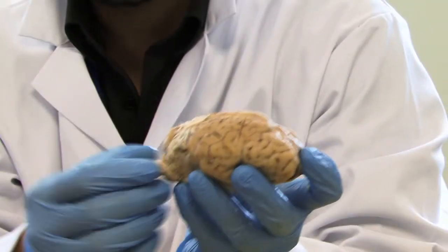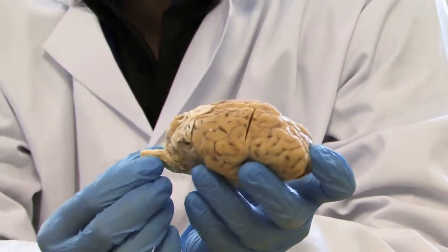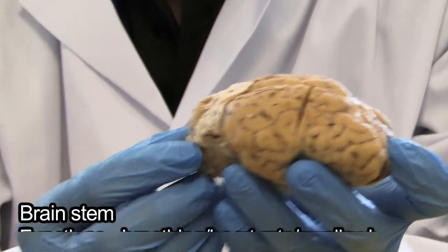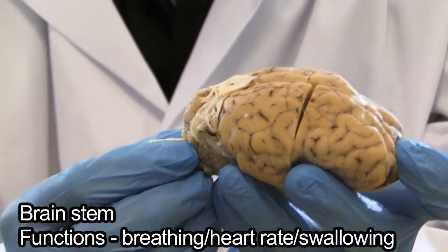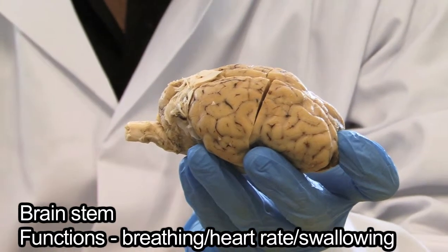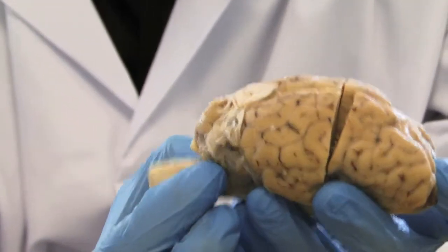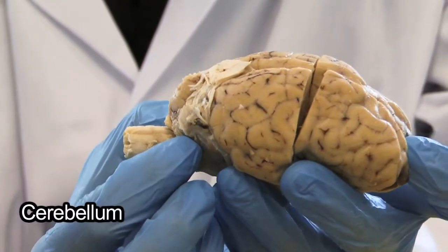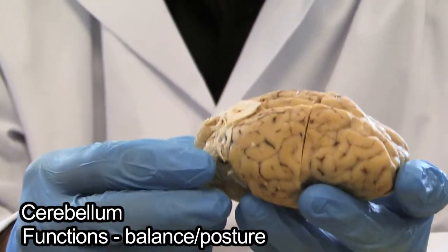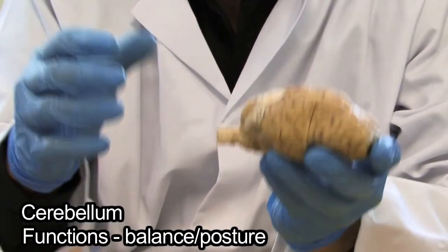First and foremost, we look at the overview of the brain. This area over here is referred to as the brain stem, and the main functions of the brain stem are to do with breathing, heart rate, and swallowing. The next structure is just this bit over here, referred to as the cerebellum. The cerebellum is responsible for balance and equilibrium — making sure that you can maintain posture.